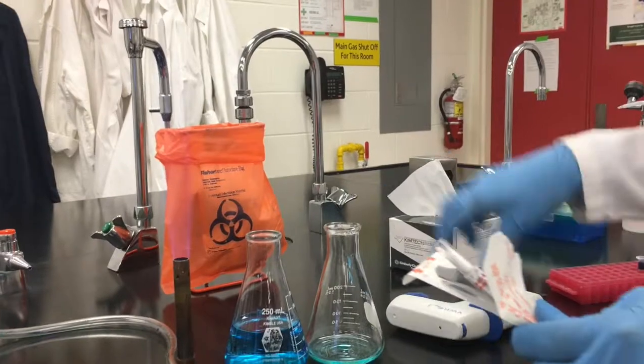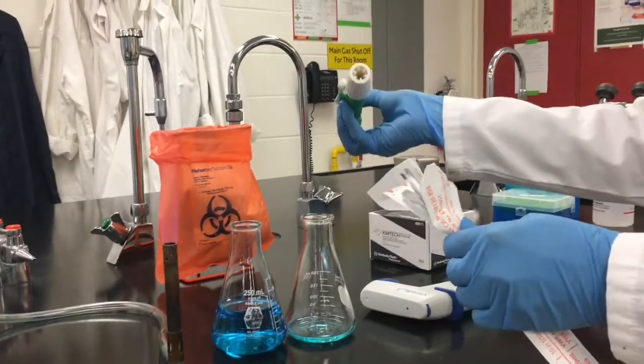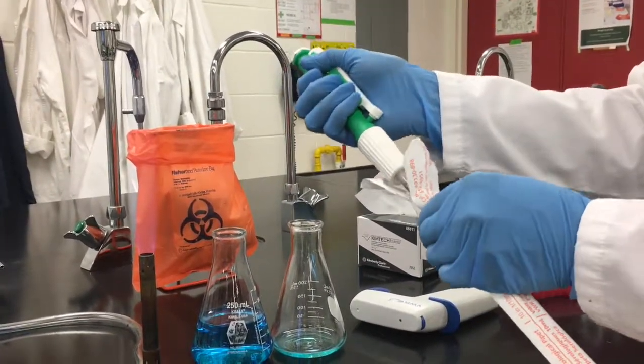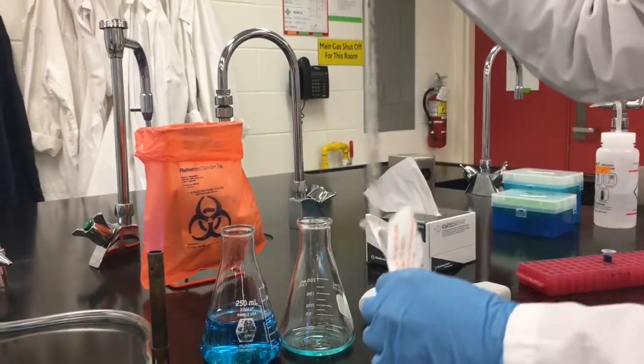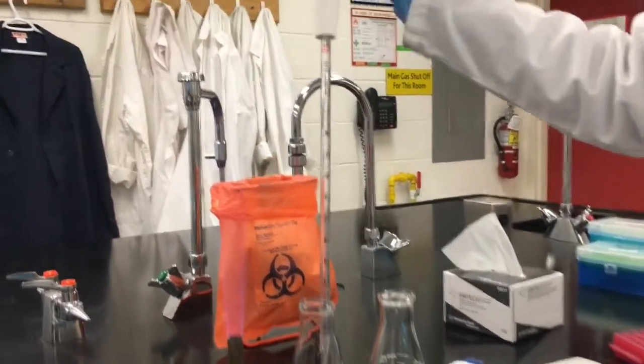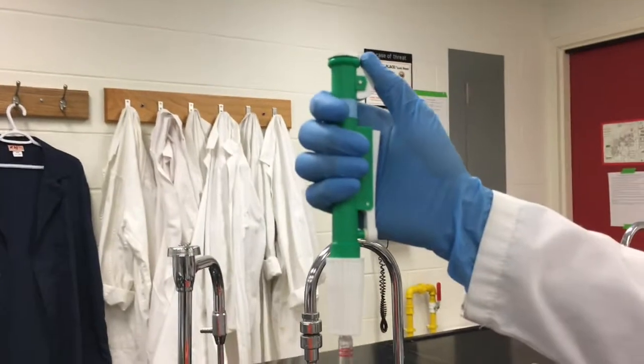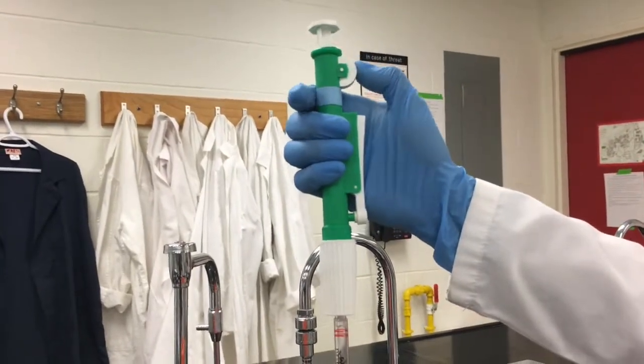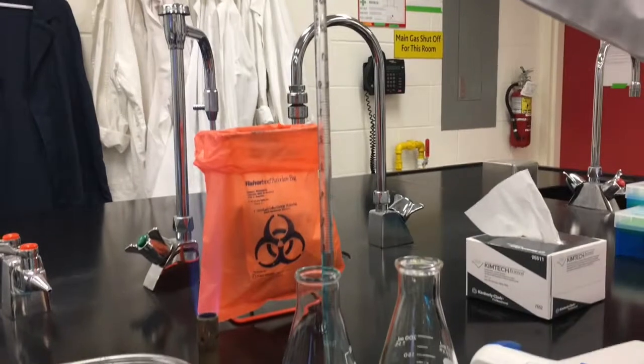The manual serological pipetter works in the same way as the electronic version. Attach the pipette tip, place the tip into the liquid and draw the liquid by rotating the circular crank. Read the volume by the ascending indicator and carefully move into the receiving container.